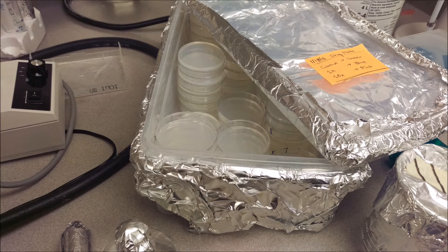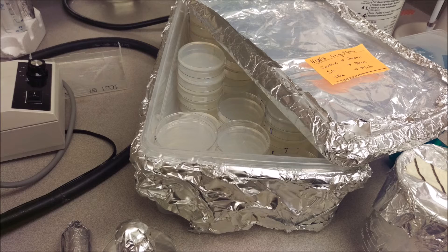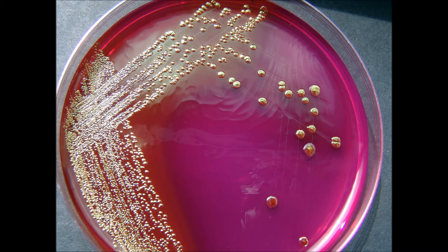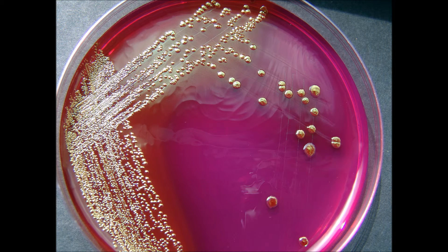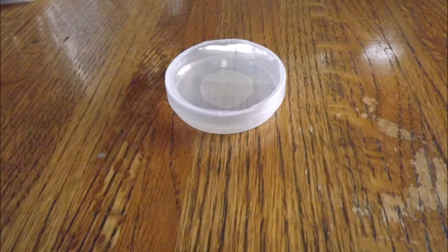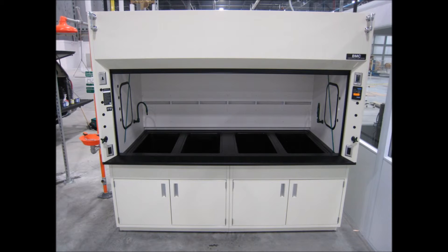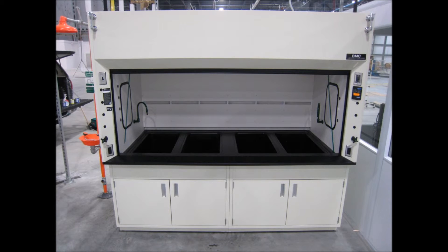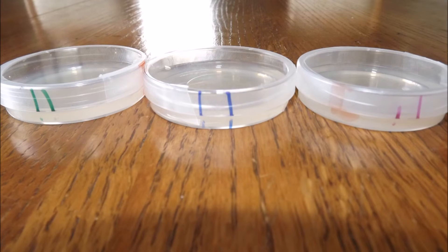So my mentor and I restarted, made new plates, grew new worms, and took extra precautions to try and avoid contamination the second time around. We added extra antibiotics to the worm plates to try and avoid any living bacteria. After the plates dried, we wrapped each plate in parafilm to avoid any spreading of possible contamination. And we agreed that any time the lids need to come off, the plates need to be kept under a sterile fume hood. With these three new precautions, we were confident it would work.